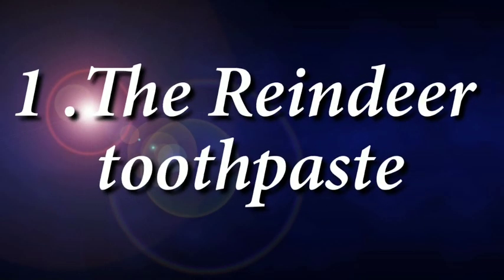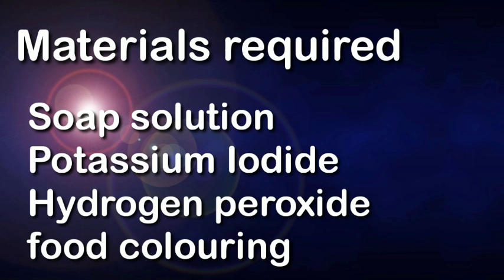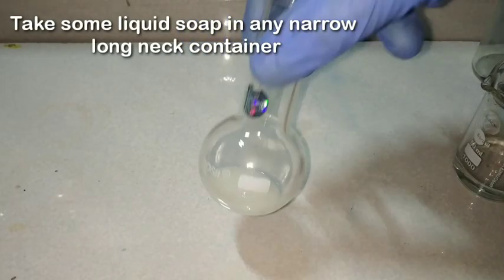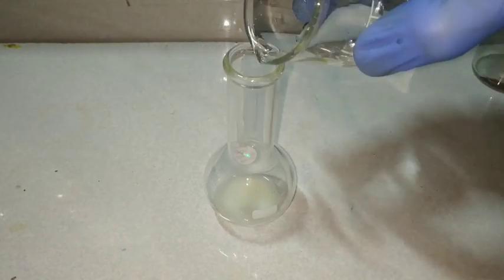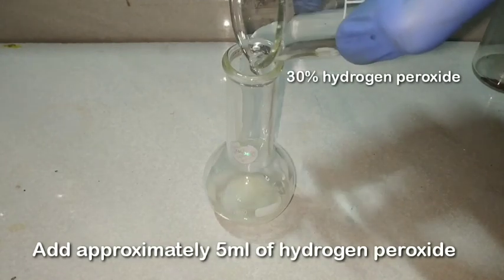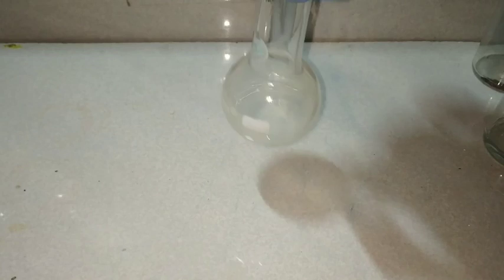Once again, Merry Christmas. We begin this video with the reindeer toothpaste — this is actually the elephant toothpaste experiment which I renamed because this is the season. The materials required are soap solution, potassium iodide, hydrogen peroxide, and some food coloring. I have taken some liquid soap in this flask, and into that I am adding 30% hydrogen peroxide, approximately 5 ml. After adding the hydrogen peroxide, I will mix that well so that the liquid soap is agitated well with the hydrogen peroxide.